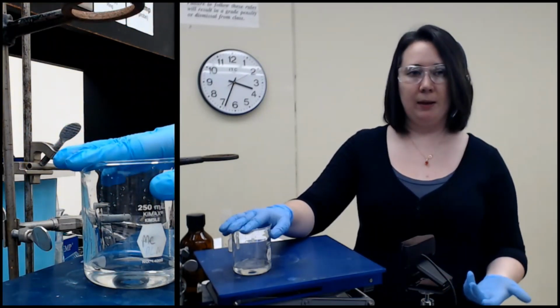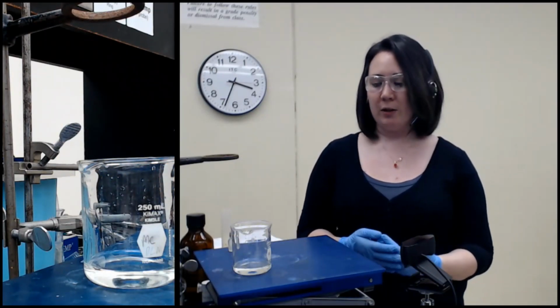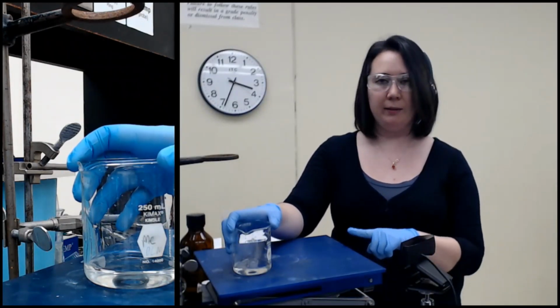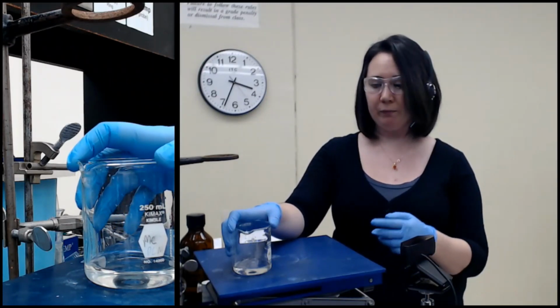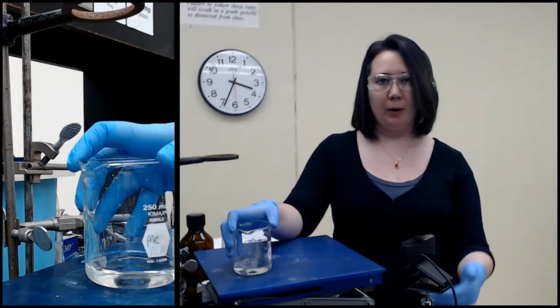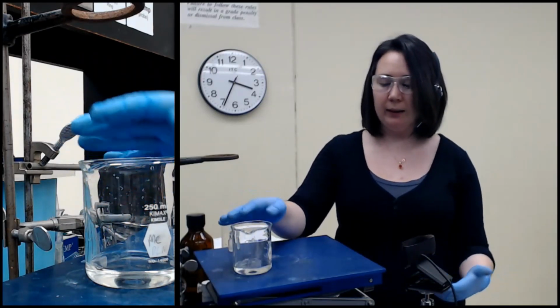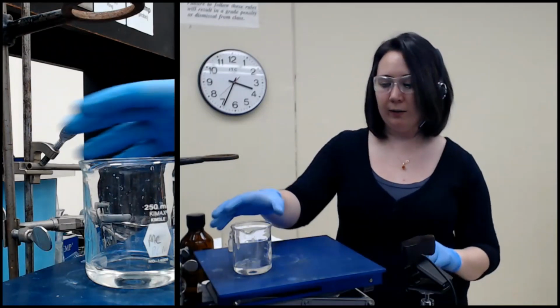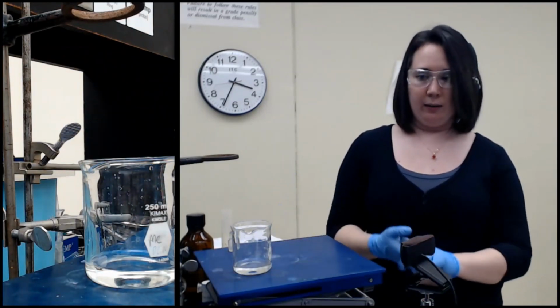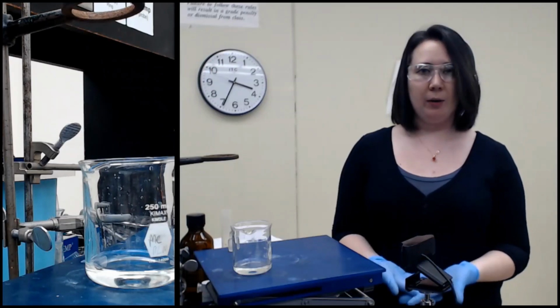Fortunately, the way that acid-base extraction ends up working most of the time, and what makes it such an efficient purification method, is that when we acidify this layer, which is basic right now because it's sodium bicarbonate, we add acid until it reaches a pH of about 2. That will reprotonate the carboxylate to give us back our neutral carboxylic acid, and it will no longer be water soluble. The only reason it's in here in the first place is because we deprotonated it. So if we give that proton back, it will have no reason to stay in the water. It will come out as a solid, and we can just vacuum filter it, and we will have our next component.